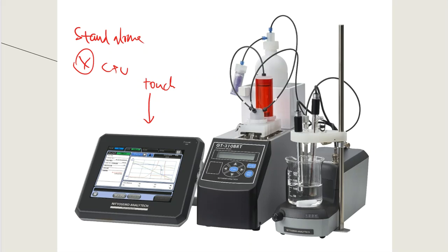It can also display, and what you're seeing here in the picture is a titration curve, so you can ensure that that titration has gone to completion before you stop the process or accept the results of that process. But a lot of the things that control the system really get controlled here with the touch screen device.